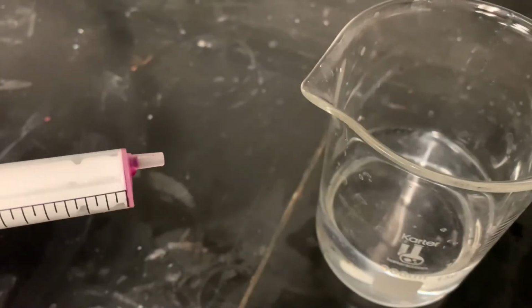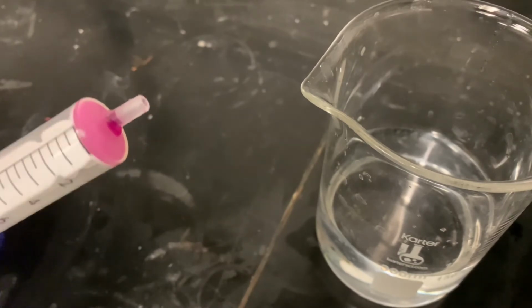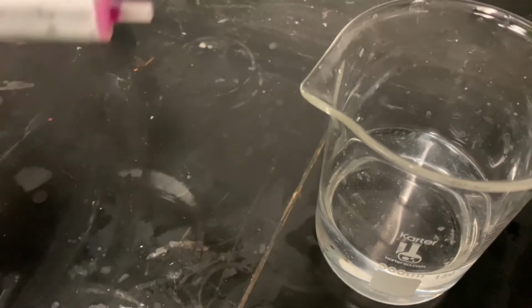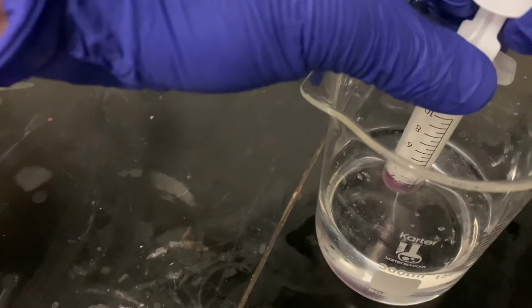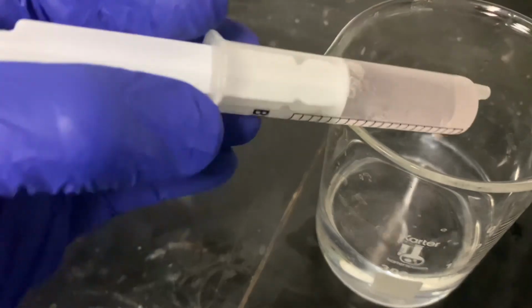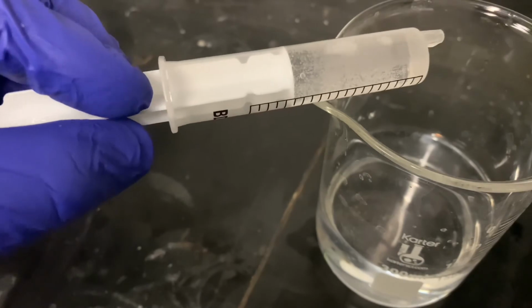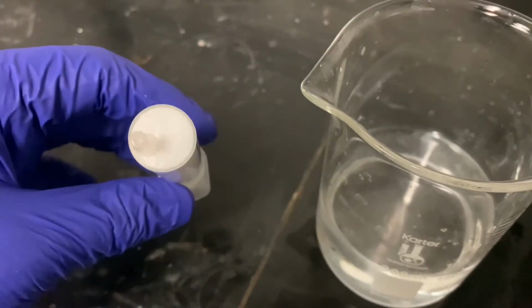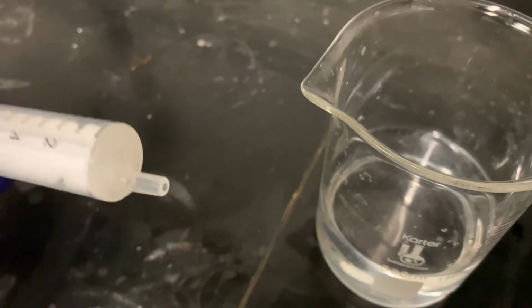It's obviously really important to properly dispose of lab waste. So here we have some permanganate left in our syringe. I don't want to throw this right in the garbage because it is an oxidizer. So we are going to stick it in the 1-to-1 ratio hydrogen peroxide and vinegar solution that we made. And I'm going to leave it in this syringe, let it mix around until all that color is out of it. And I'm going to eject it, inspect for color again, and now I can throw out my syringe in our solid waste lab container.